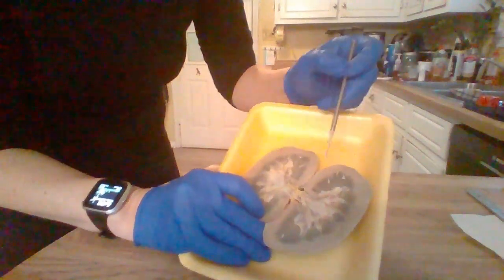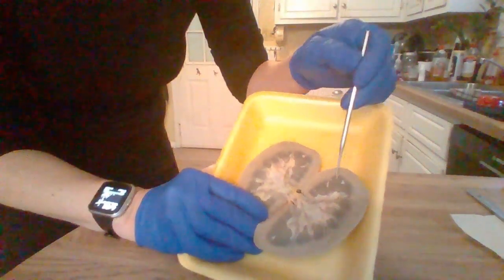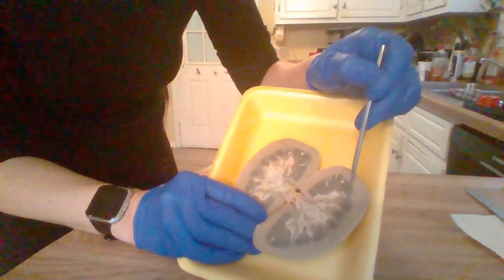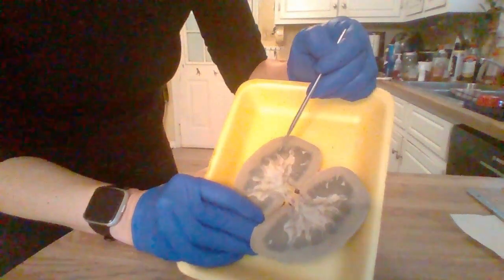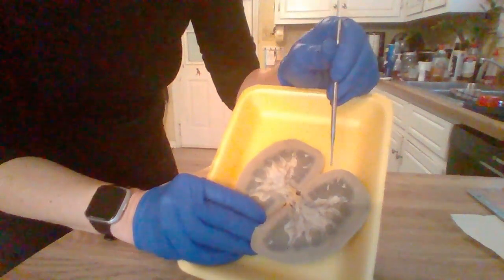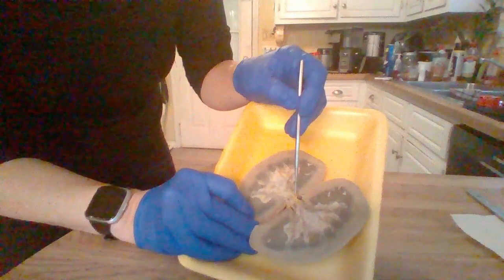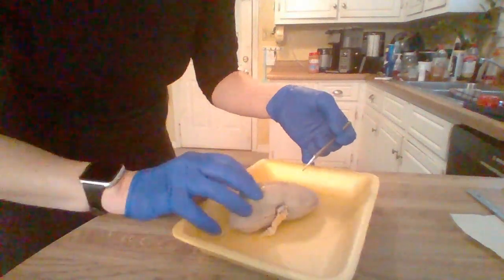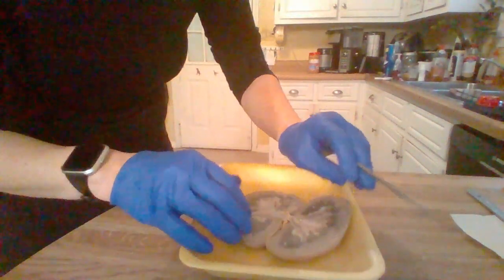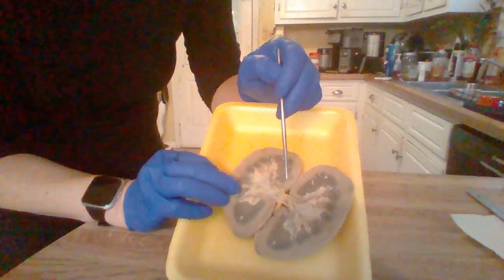Okay, so out here along the outer part right here, we have the renal cortex. And then here, these are the renal medulla. And each of these renal medulla right here, there's the renal pyramids. It has a papilla there at the renal pyramids, and then we have the renal sinuses right here, and the renal hilum, I guess, goes all the way here. Maybe it's better to see all around here is the renal hilum, where they enter and exit with the renal artery and vein and the ureters.